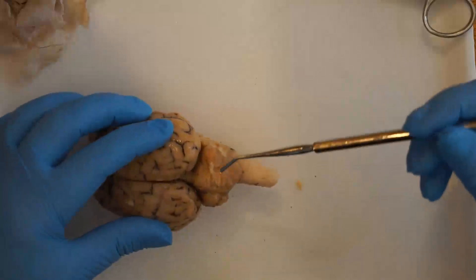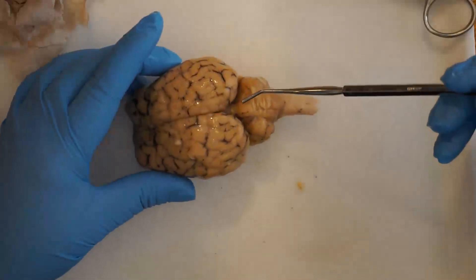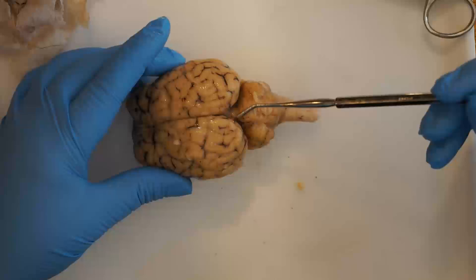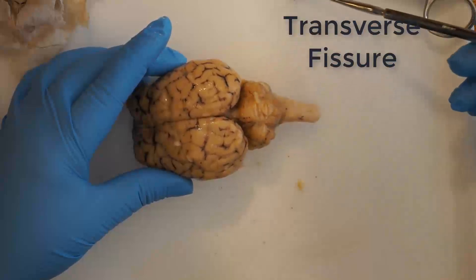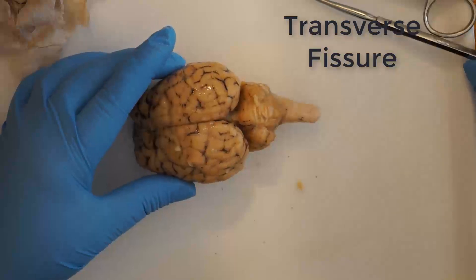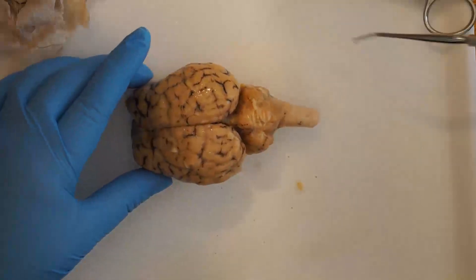If you flip the brain back over, you can see the other major fissure across the brain — that is the transverse fissure — and that divides the cerebrum and the cerebellum.